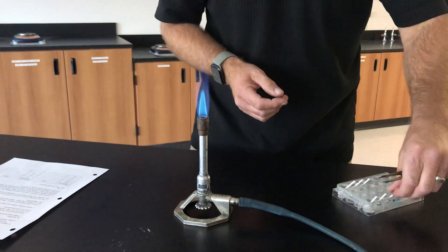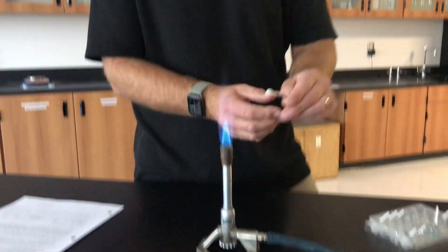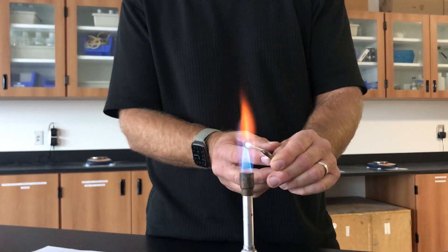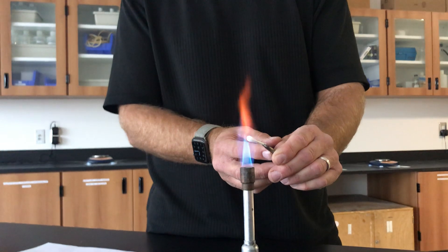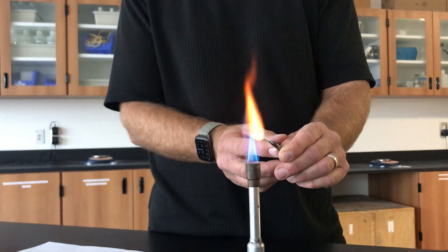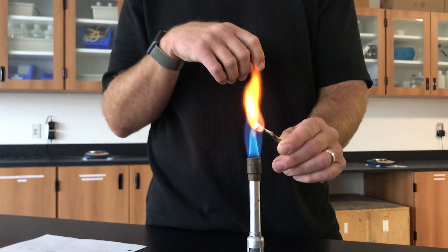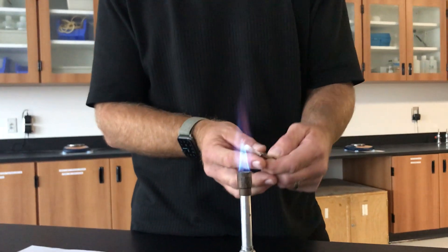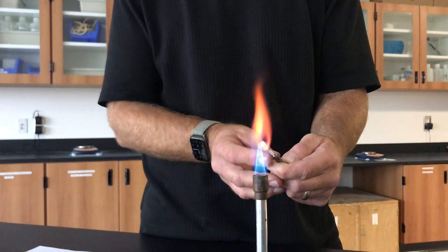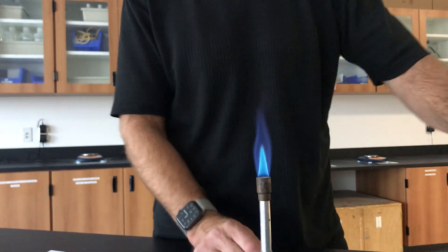We're moving on then to potassium. Potassium is K on the periodic table. This is our flame test then for potassium. Not over here on the left, but to the right is your flame test for potassium. It's the color on the right that you're observing. There's our flame test for potassium.